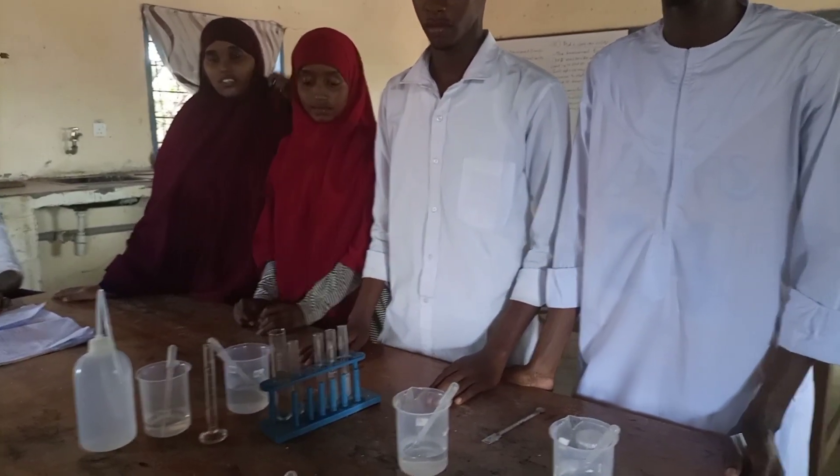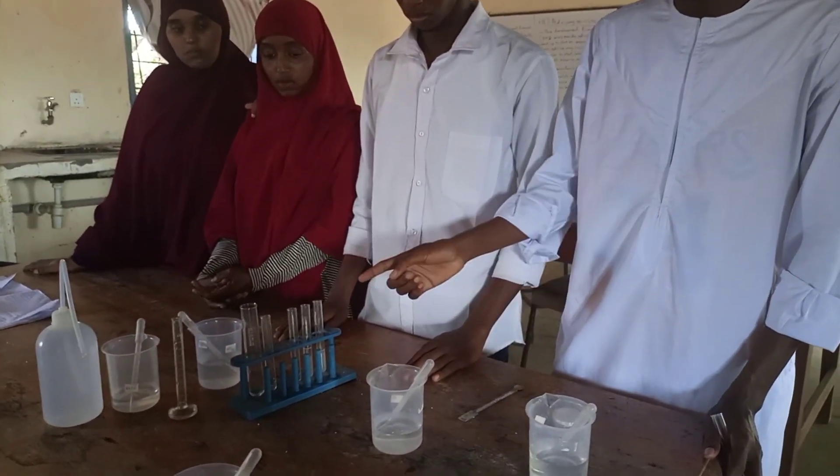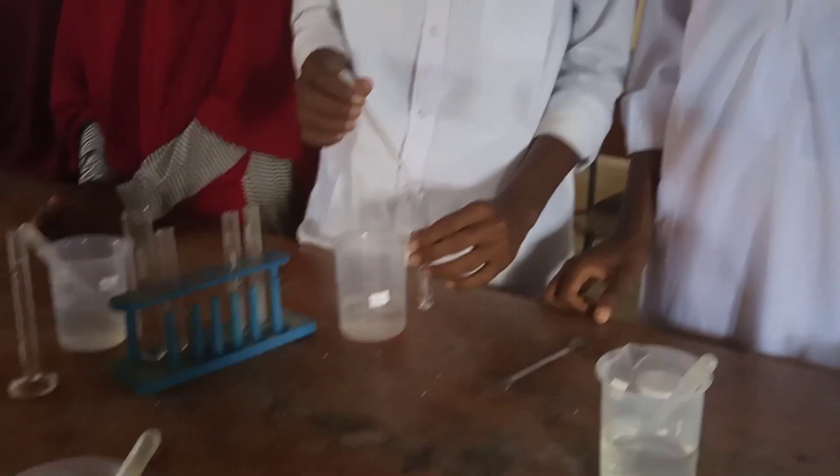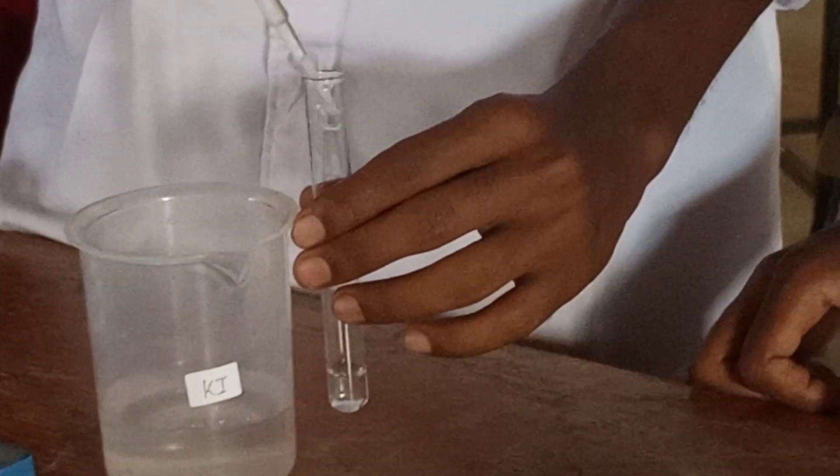For procedure four, take the third portion and add three drops of potassium iodide. The observation is no yellow precipitate is formed. Remember, potassium iodide only tests for lead ions — if you get a yellow precipitate, lead ions are present; if no yellow precipitate, lead ions are absent. In our case, lead ions are absent.